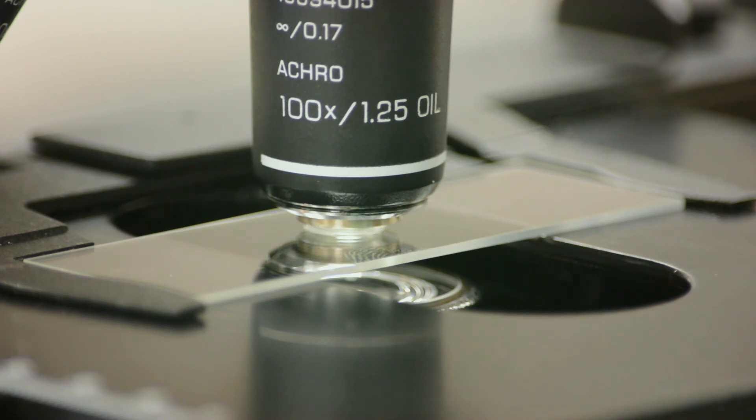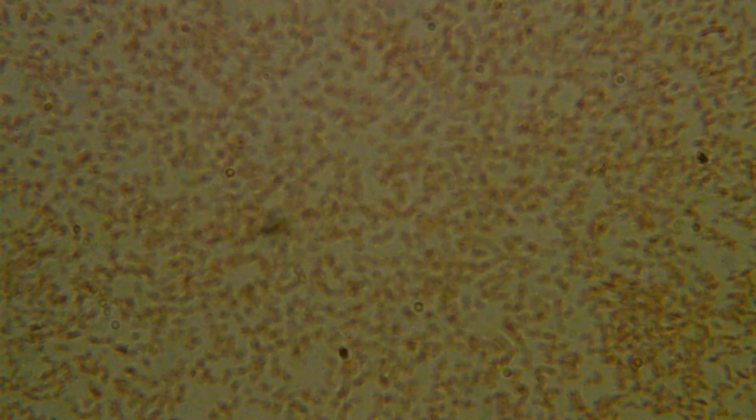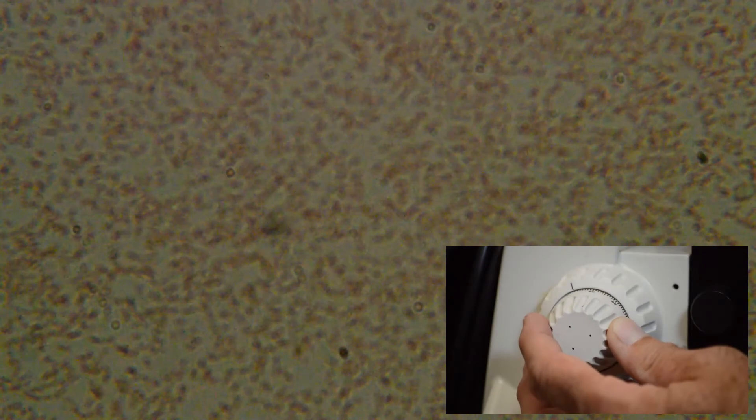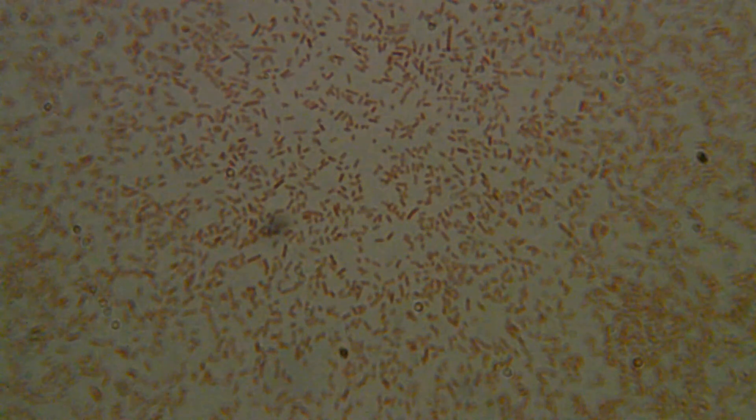And once it has touched the objective only use the fine focusing knob. Now be very careful and do this only very slowly because you can go past this very quickly. You slowly bring this into focus, and as you do that you can now observe the material under the microscope.